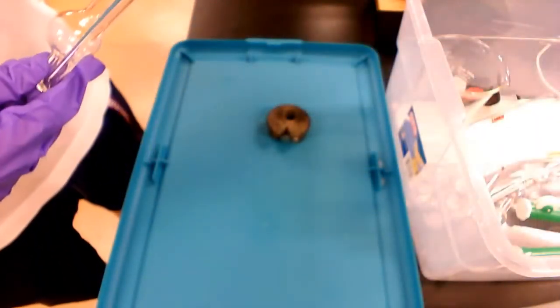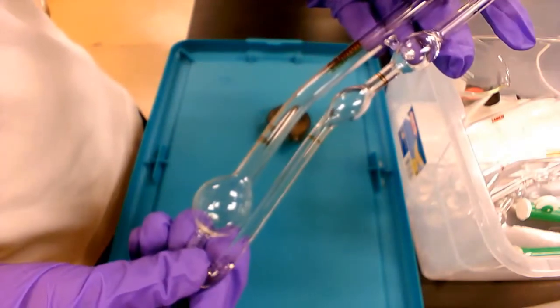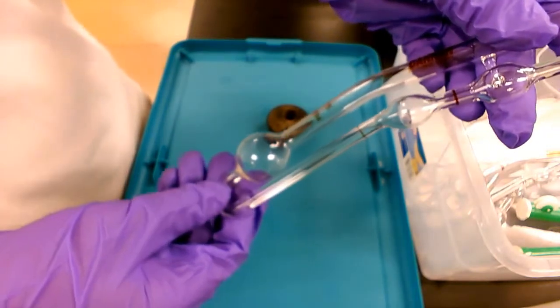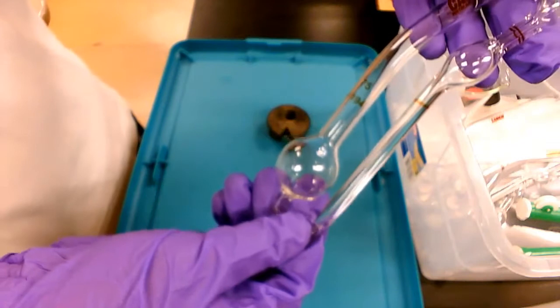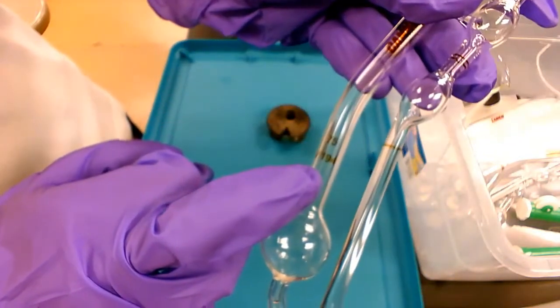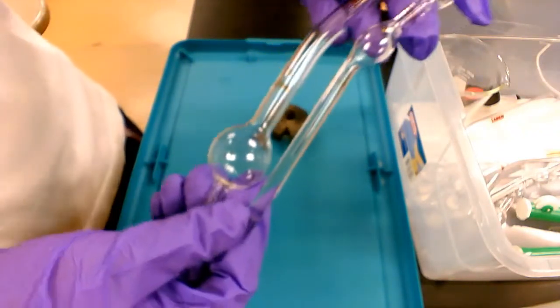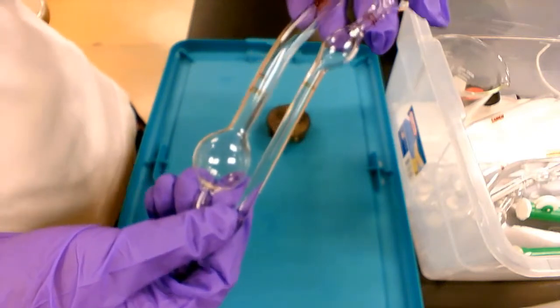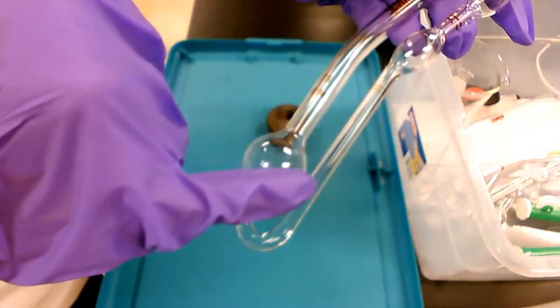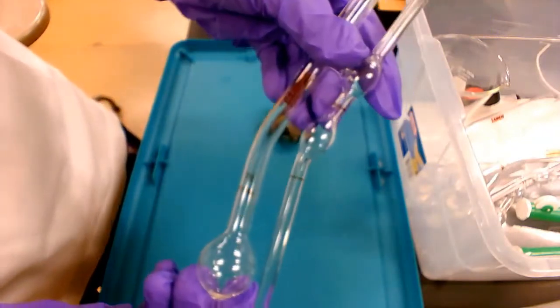To start the measurement, the first step is to set up the viscometer. You need to write down what viscometer you are currently using. In this case we are looking at a V194 viscometer. It's important to record this because the flow time of each viscometer is different — the inner diameter of the tubing inside varies from one viscometer to another.